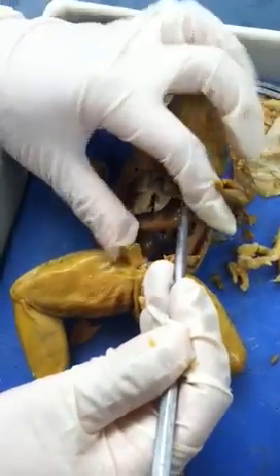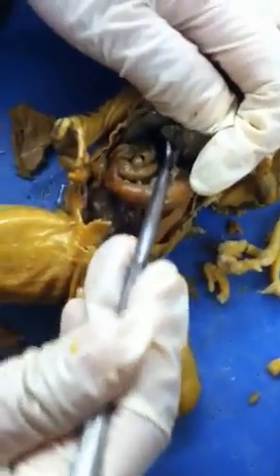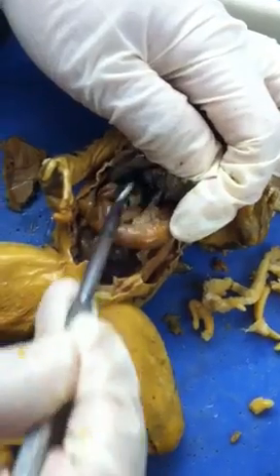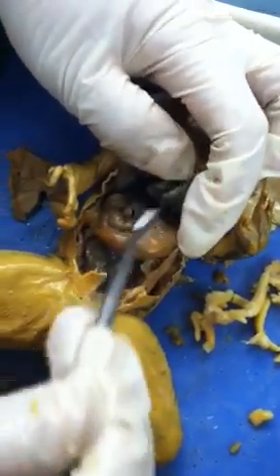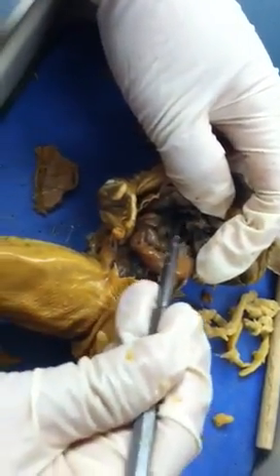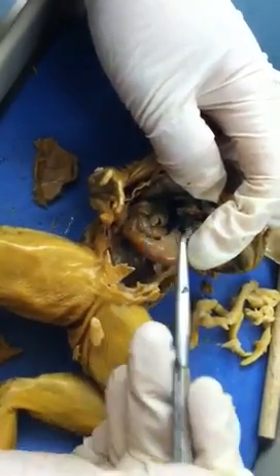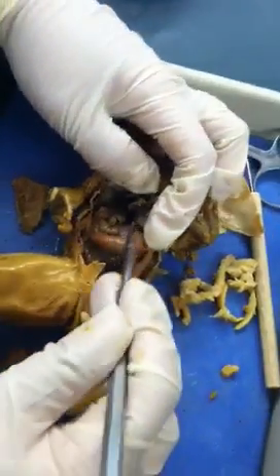If I lift the liver up a little bit, you will see a sac right beneath it — that's the gallbladder. It's kind of attached to the liver. The purpose of the gallbladder is storage of bile. So just remember: gallbladder is a sac beneath the liver that stores bile.